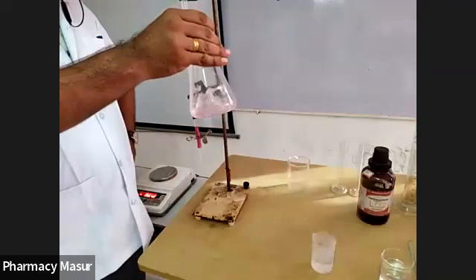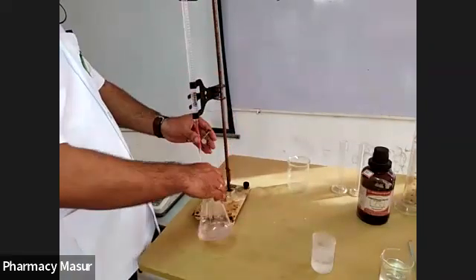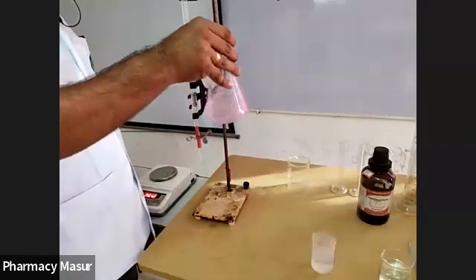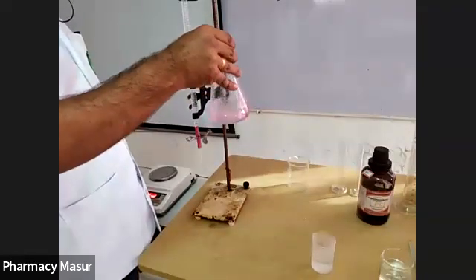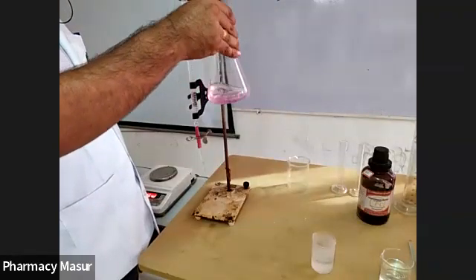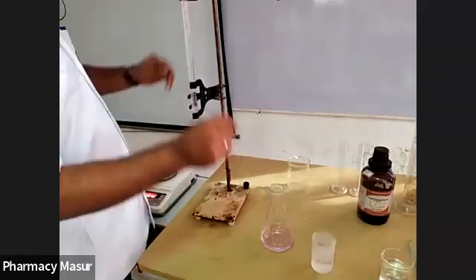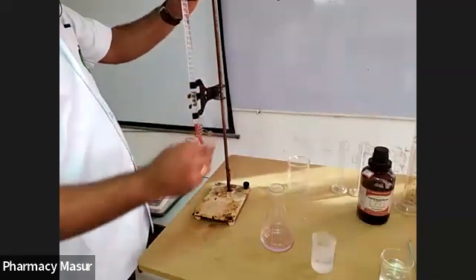This is the permanent color change. You just have to add a single drop to convert this colorless solution to just pink. This is the endpoint of the reaction. For this color change, the amount of NaOH required can be calculated using the burette.